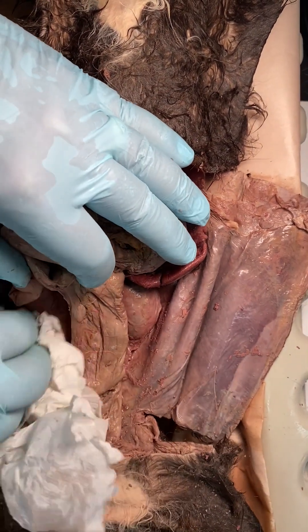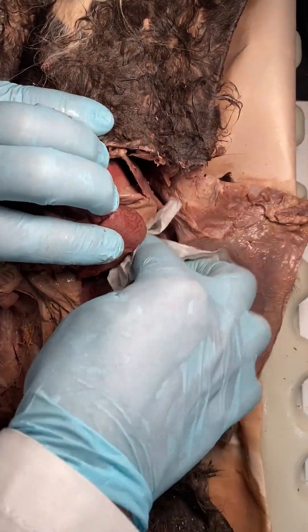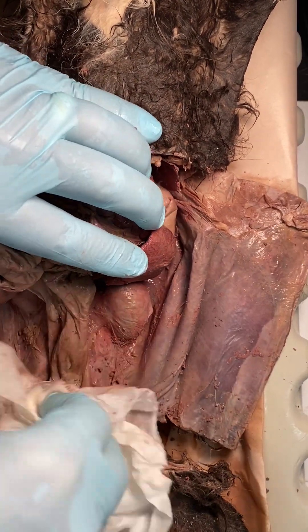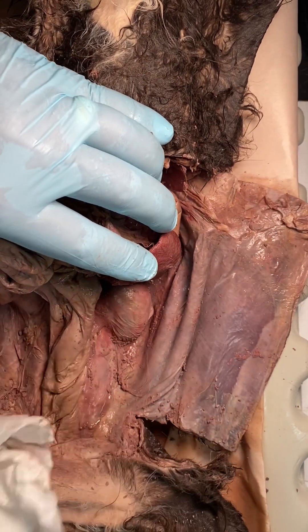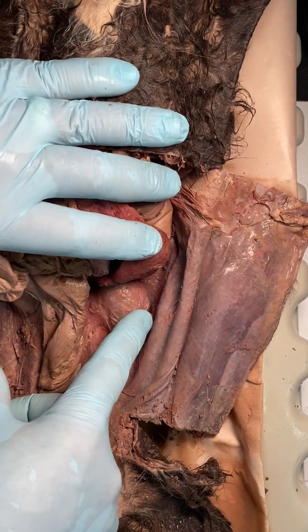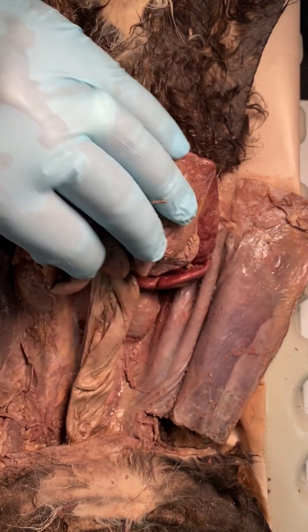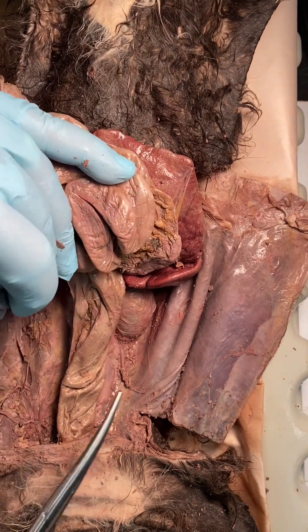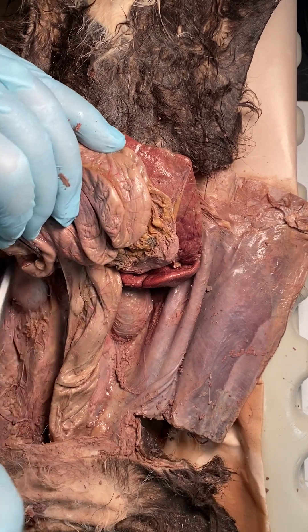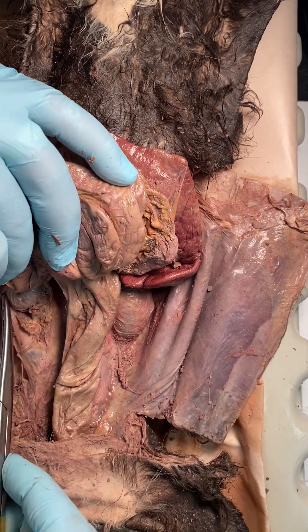There's still cleaning up to do because the blood vessels are going to be very deep — they're retroperitoneal. To find the peritoneum, a good way to start is to find the kidneys. There's the left kidney and the right kidney over here. You can see they're covered with something — that's the peritoneum — and you want to get that coating off.